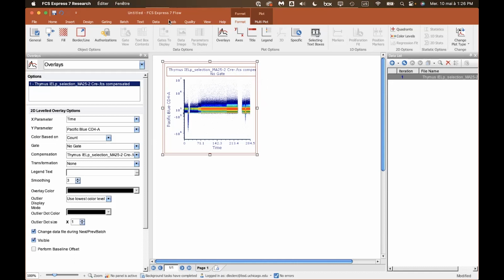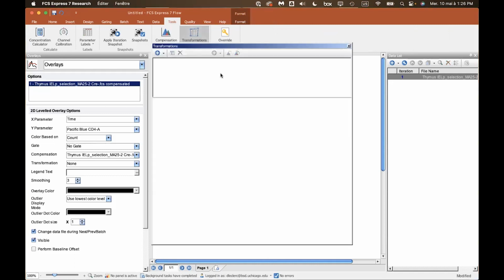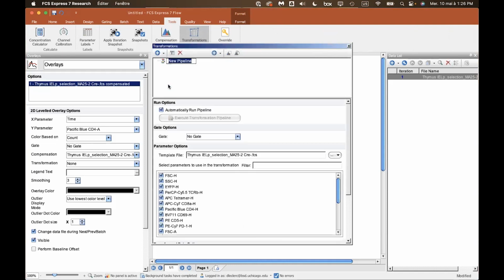So in FCS Express, what we're going to do is go to Tools and Transformations. And essentially, we're going to go to the plus sign over here to apply a new transformation. There's a bunch of things we could do, but right now we want to apply a pipeline. The pipeline would basically allow us to line up a series of algorithms in order to get to something that's relevant biologically. Currently, I just want to run Flow AI, so that's what we'll do.